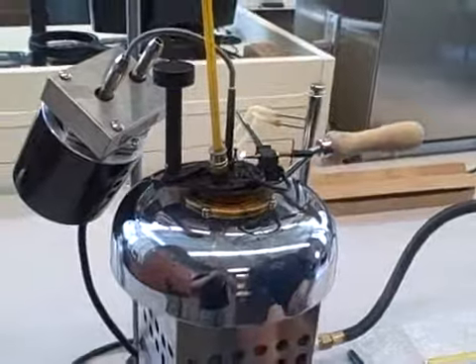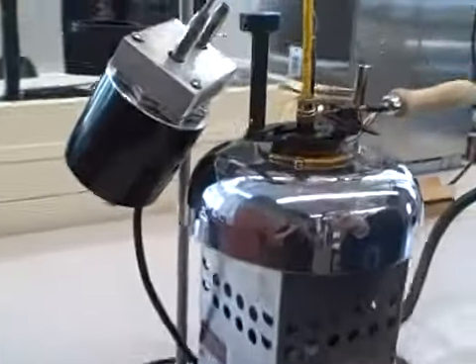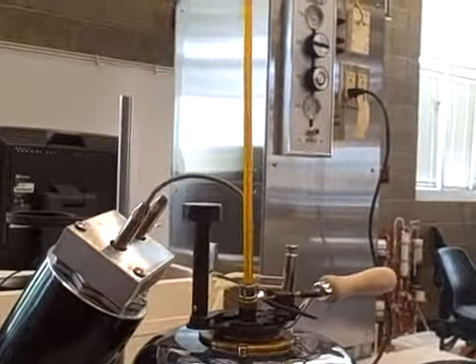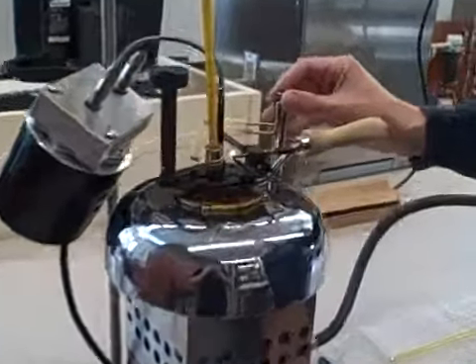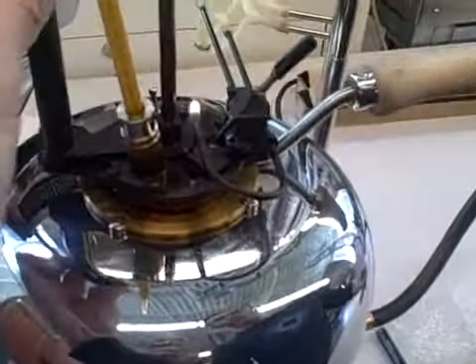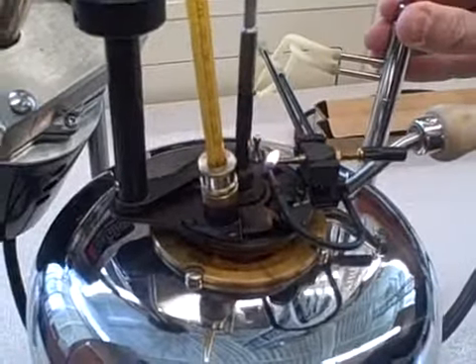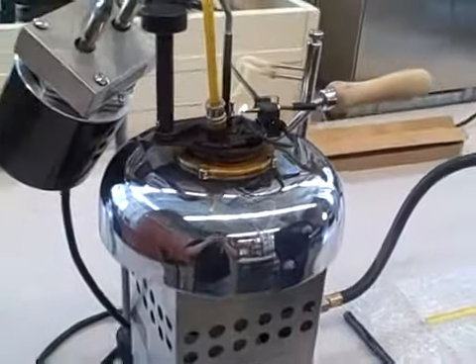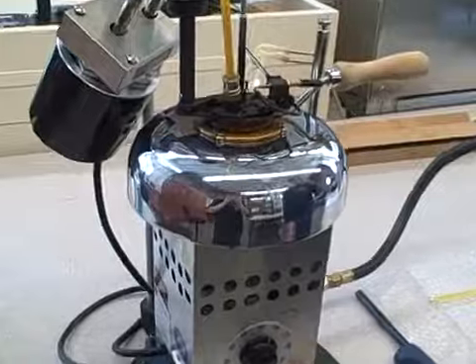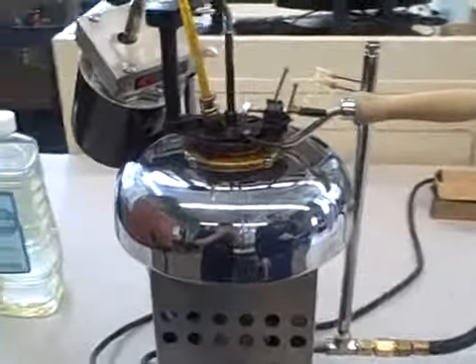So you restart the stirring device and wait a couple more degrees. We are at about 188 now. I will turn off the stirrer and dip it again. You probably didn't see it, but we had a tiny little flash there — helps to do it with the lights off. You just go up in multiples of two, up until you get 220 Fahrenheit, but in this case we already had it at 188.